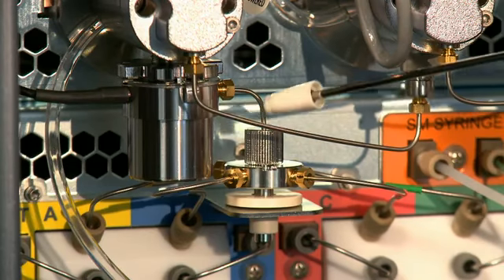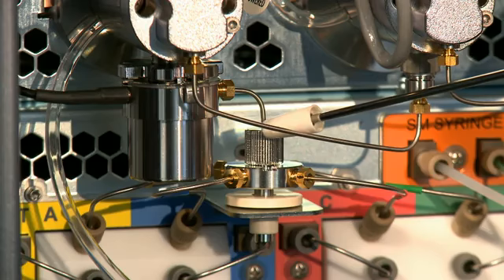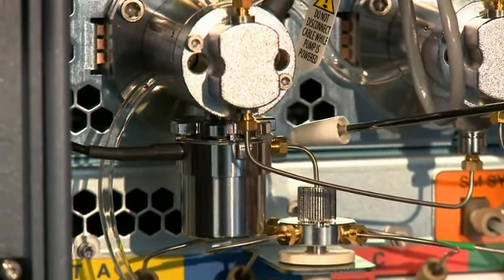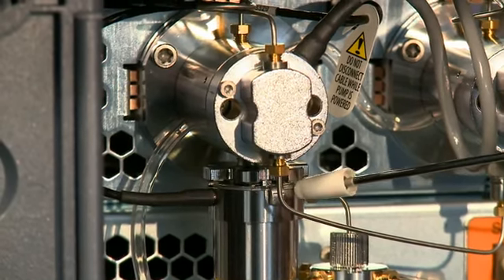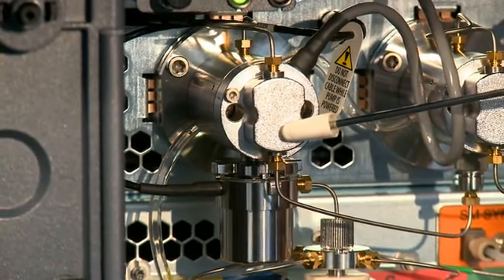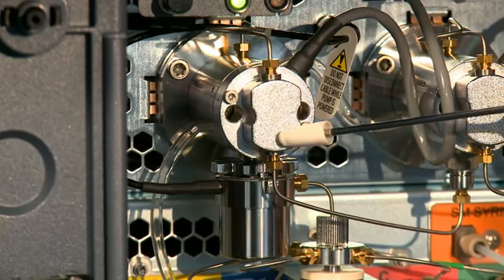The 4 solvents meet at the manifold and leave the manifold as a series of solvent segments like railroad cars. They enter through the intelligent intake valve and into the primary pump head, where the solvents for the first time are in the same common volume and begin to mix.